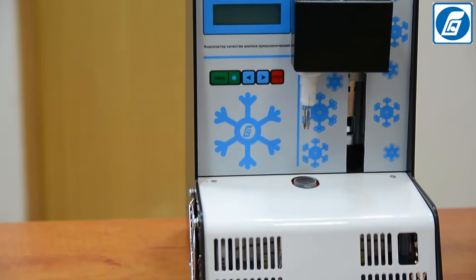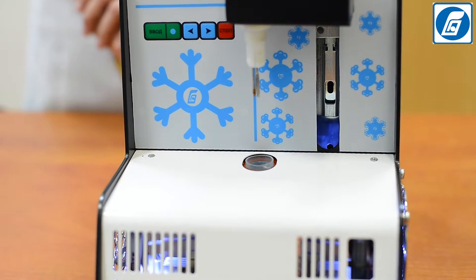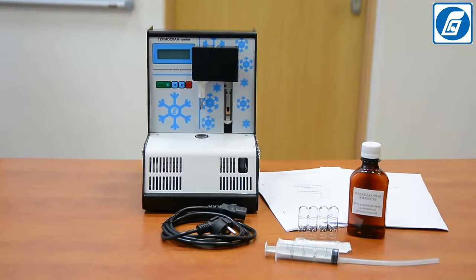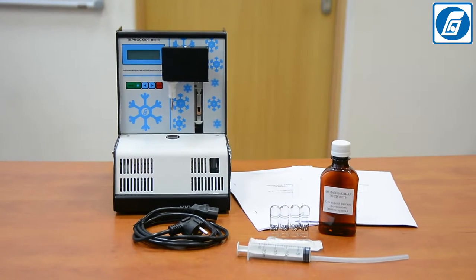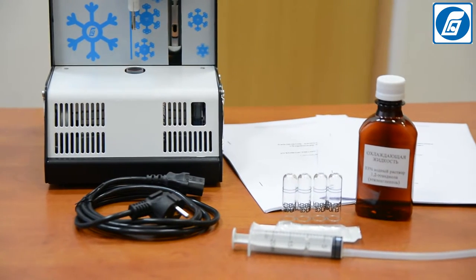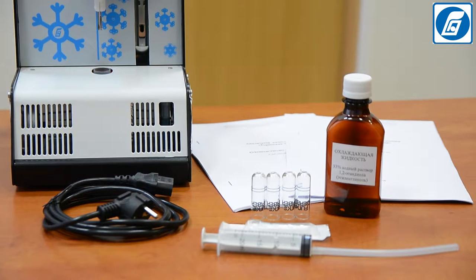After receiving the milk analyzer from the manufacturer or warehouse, check the box and make sure the packing is intact. After unpacking, check the completeness of delivery according to the packing list, and inspect the analyzer externally for safety seals and absence of mechanical damages.